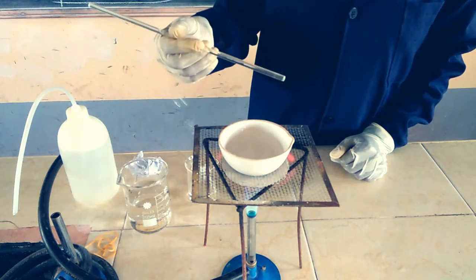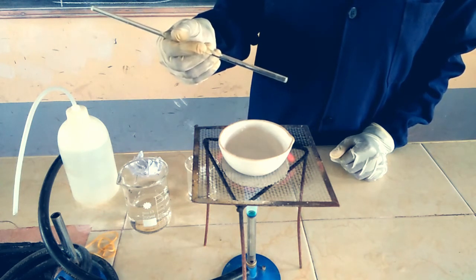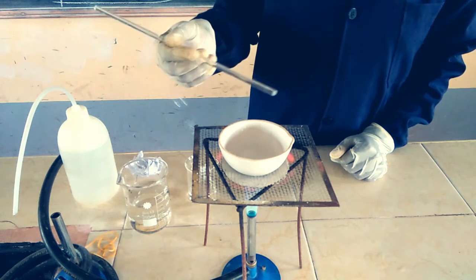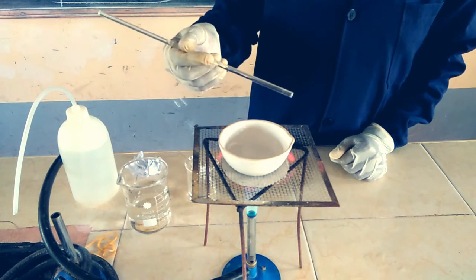Once we have driven out the excess water and see salt forming, we're going to transfer it onto a water bath so we can evaporate slowly to avoid the spitting out of the sodium chloride salt.